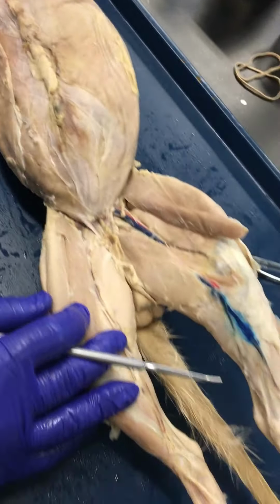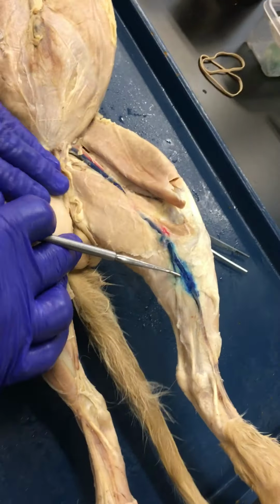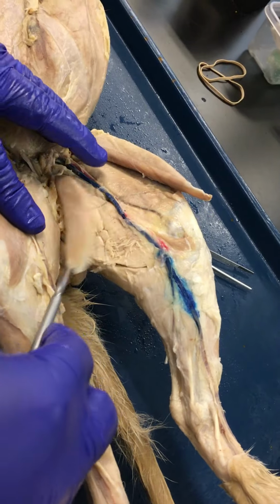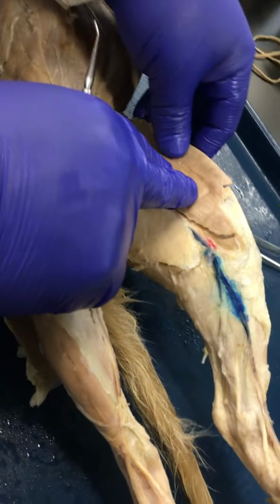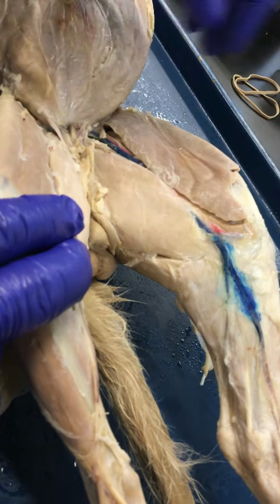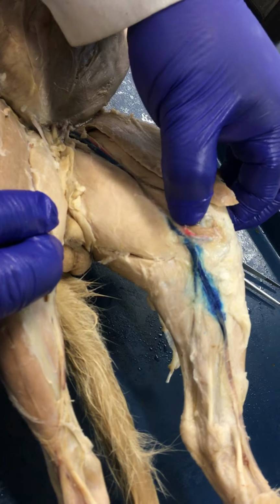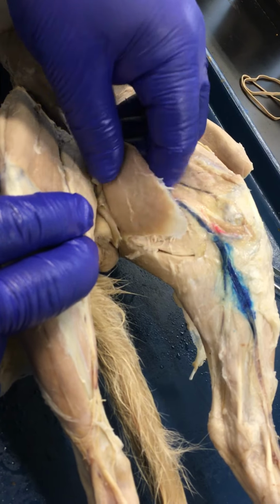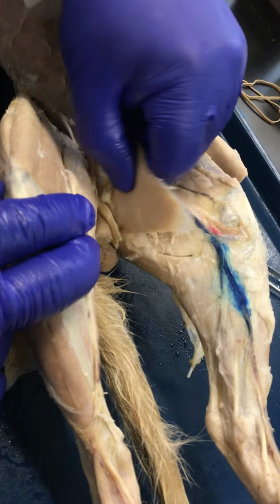And as we make our way down to the leg, the superficial muscles that you would see in the cat, essentially covering everything, are going to be the sartorius, this large band-like muscle here, and the gracilis. Keep in mind, in humans, you don't have that same type of wide muscle. Instead, in humans, the sartorius is just a thin band, as well as the gracilis on the medial aspect. As far as the sartorius, this is going to laterally rotate the thigh, as well as help flex the knee. And the gracilis is also going to be involved in knee flexion and assist with adduction, ADD, adduction.